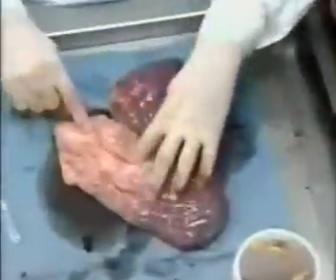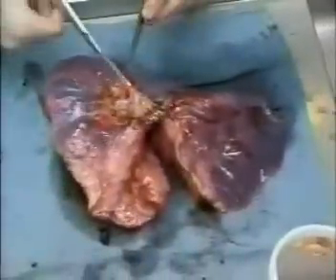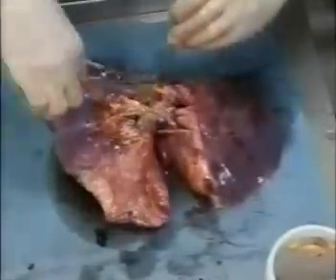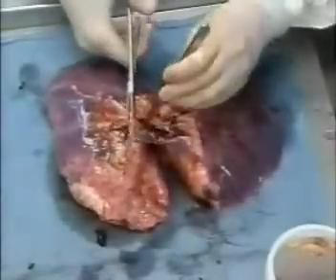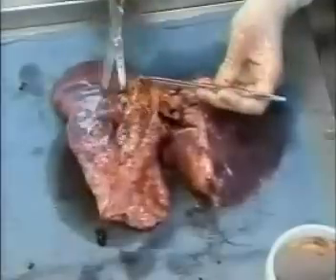This is the right lung. You can tell it's the right lung because it has three lobes. The left lung normally will have two, though sometimes multiple lobes can be found in both lungs — up to five separate lobes may be seen. Dr. Fricke is now opening the main bronchus of the right lung and following it out through its primary and secondary divisions. The purpose of this is to see if there's any evidence of disease or other abnormalities such as obstruction by foreign bodies. She's now examining the liver.